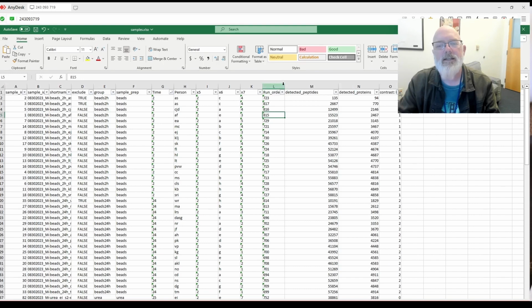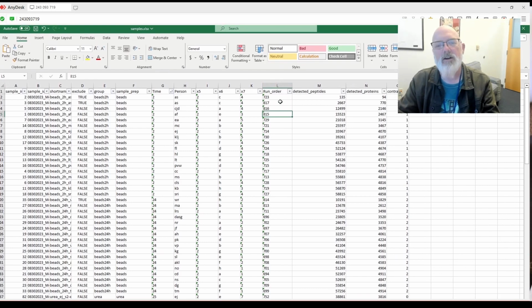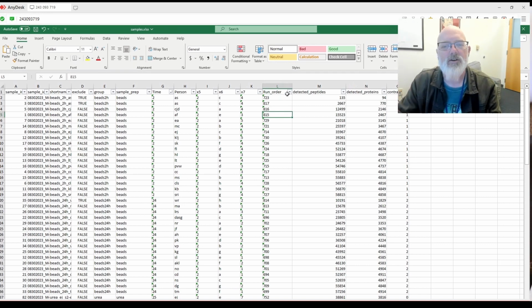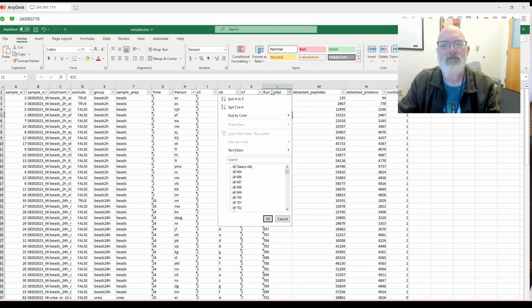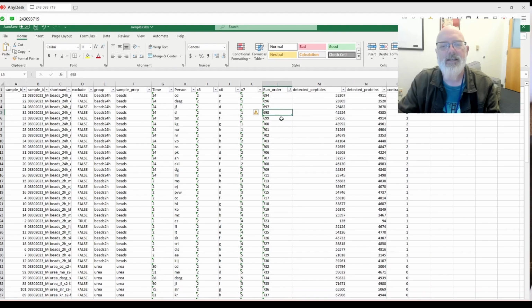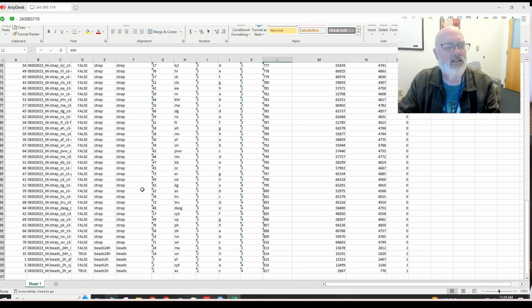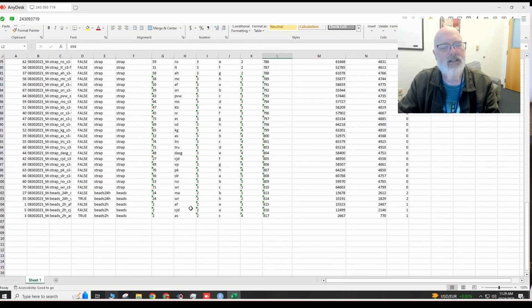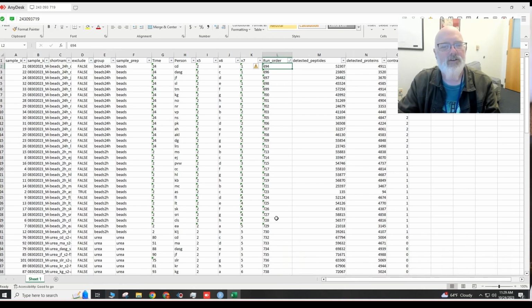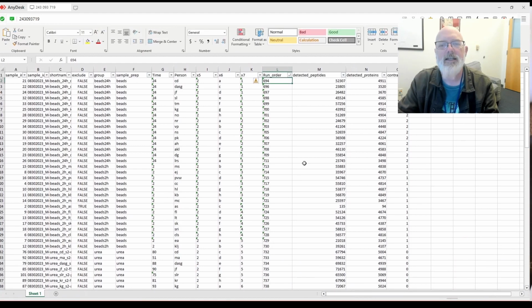What's nice about the Bruker timsTOF is it appends this run order number or your sample ID number, and it's consistent across all your queues, so it's wonderful. For example, this isn't really run order, but if we sort this from A to Z, this would be the first run, and you can see we didn't randomize these. We just ran them, except these were run at the end. So we can look at variation in run order. Usually I like to randomize these, but we didn't in this case.